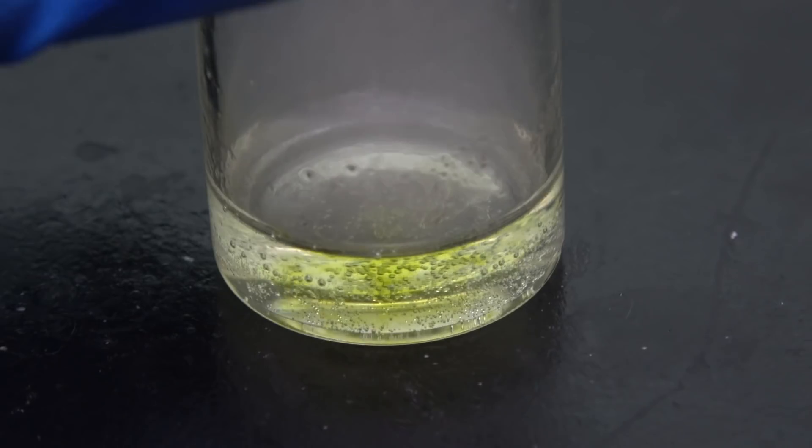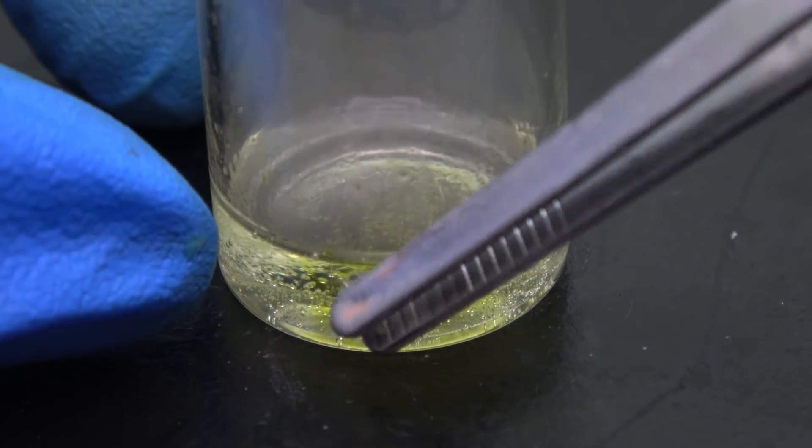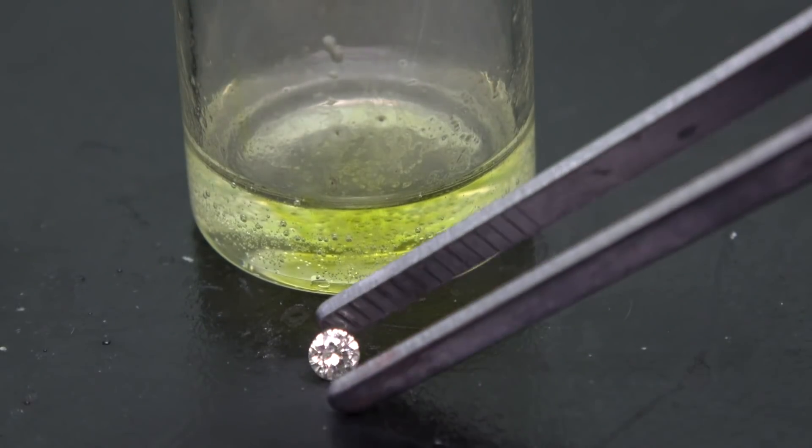Now let's take the diamond out of the vial, see if any damage is done. And it is as good as new.